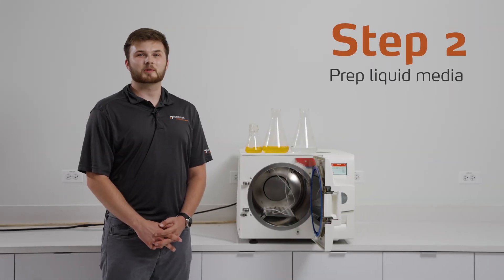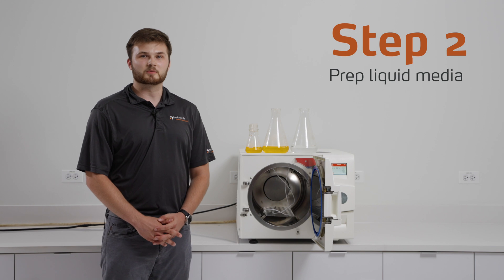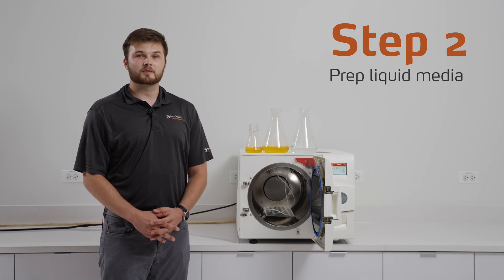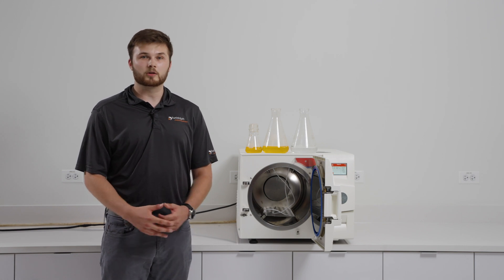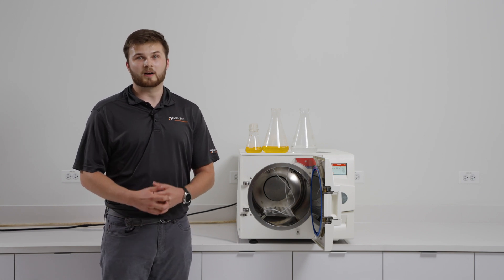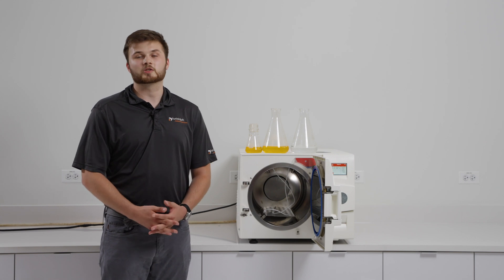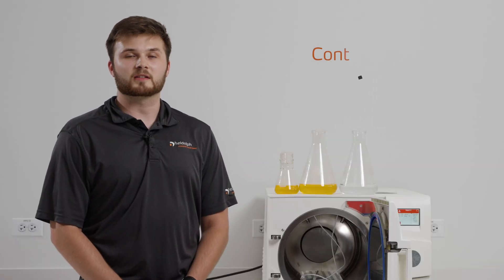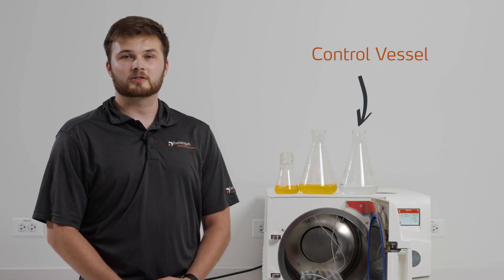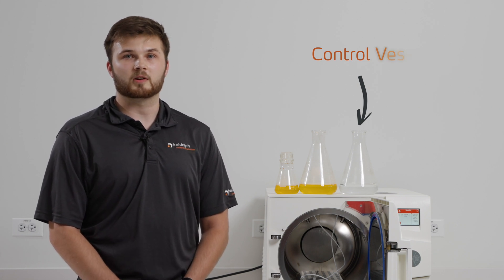The next step is to prep your media. When sterilizing liquids, we do not recommend filling any vessel more than two-thirds of the way full. The reason for this is that in the event there is boil over, it does not boil over out of the vessel into the autoclave which can then damage the unit. If contamination is a concern, we recommend using a control vessel of water to put the probes in to monitor the temperature of the liquid during the process.